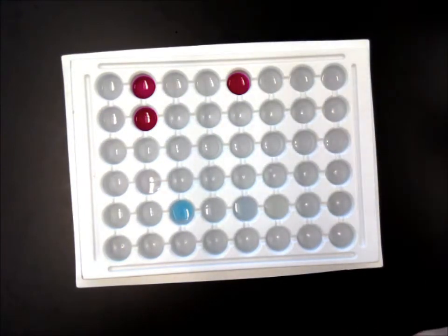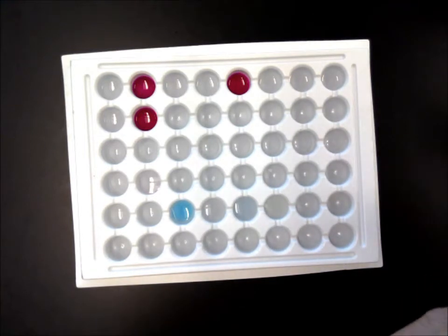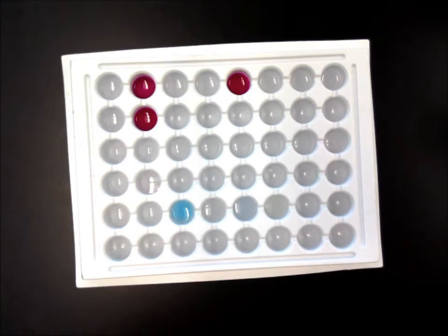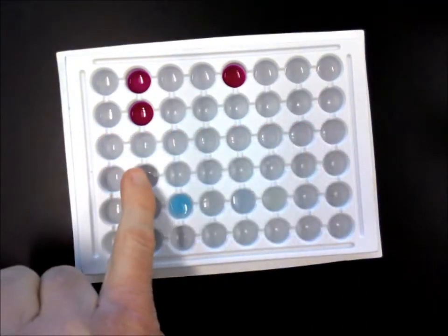And that's what the indicator is for, to tell us whether it's an acid or a base or neutral and give us a rough idea. The problem with phenolphthalein is there's only 2 possible colors, clear and pink. So it really doesn't give us a lot of information about pH, which of course is that measure of acidity or basicity. So what I did down here is I have these same 10 compounds in the same order.